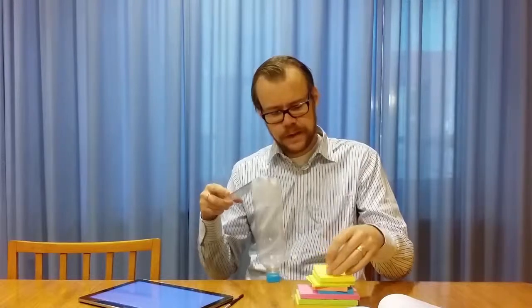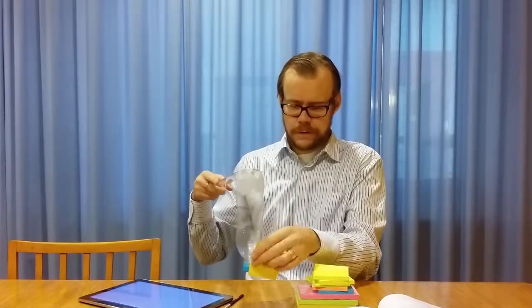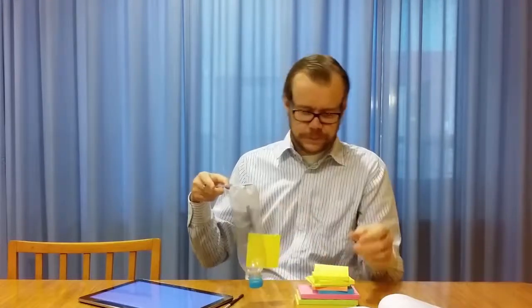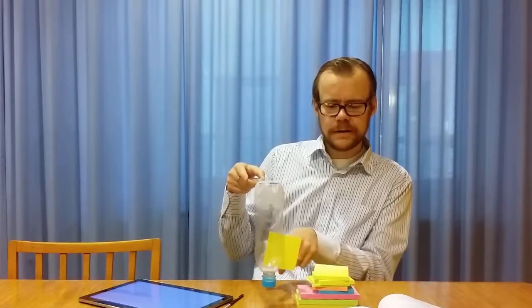The second problem that can arise is that you scan the surface like this, and then a small piece of the sample is... Let's see if this is possible. Like this. After you've scanned for a while, a small piece might get stuck onto the tip like this. And that means that now when I scan, a part of this will start to have interaction with the sample. So this obstacle here, this debris, will interfere with my measurement. And this means that the tip's geometry here has changed. And then I will map a different contour than what I was doing in the beginning.